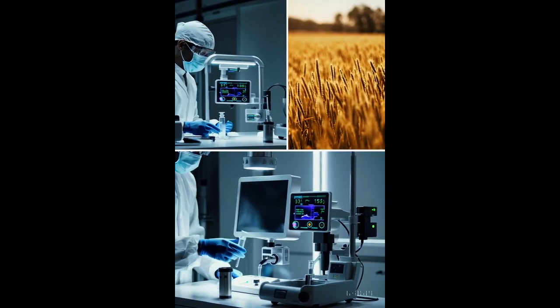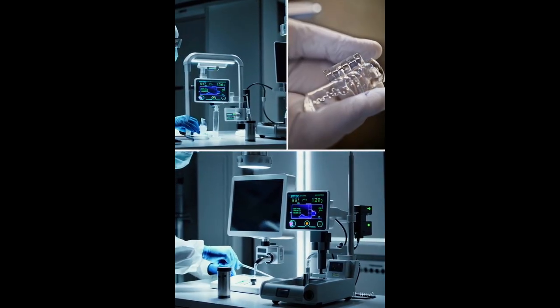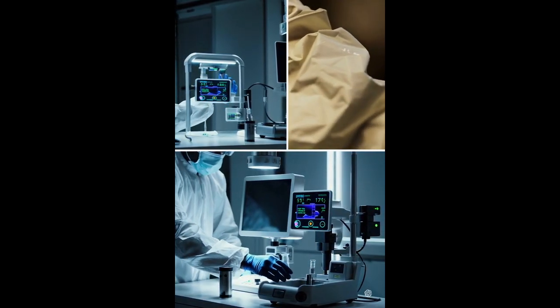Researchers can now create diagnostic tests for emerging pathogens in the field, monitor water systems for pollution, or track engineered microbes with synthetic DNA barcodes, all without sharing sensitive data, or even needing the internet.